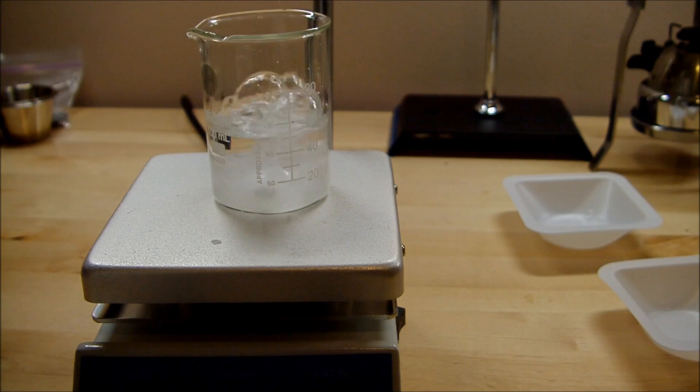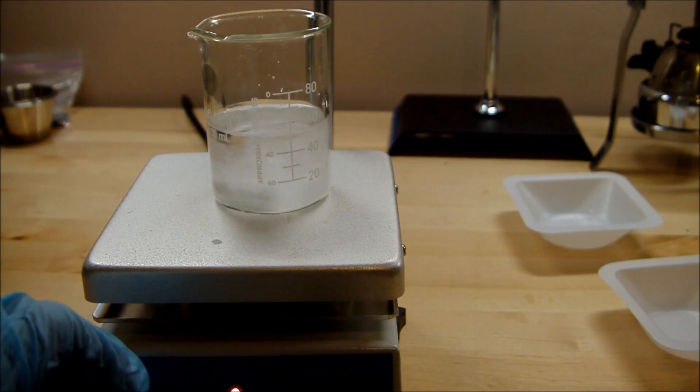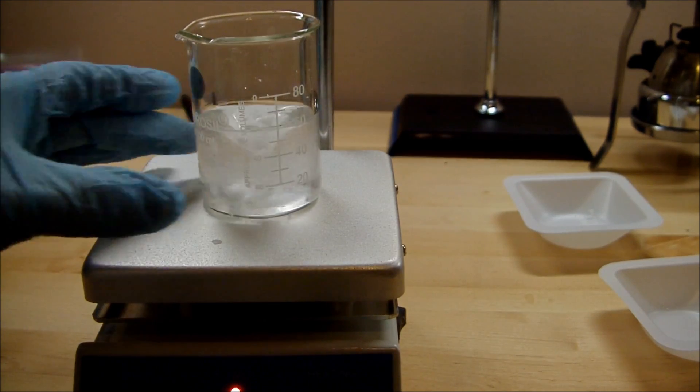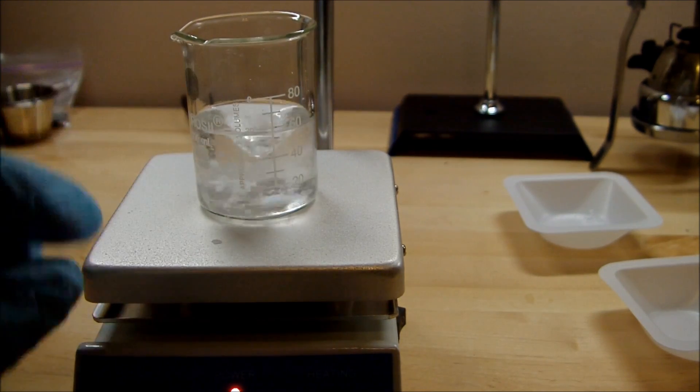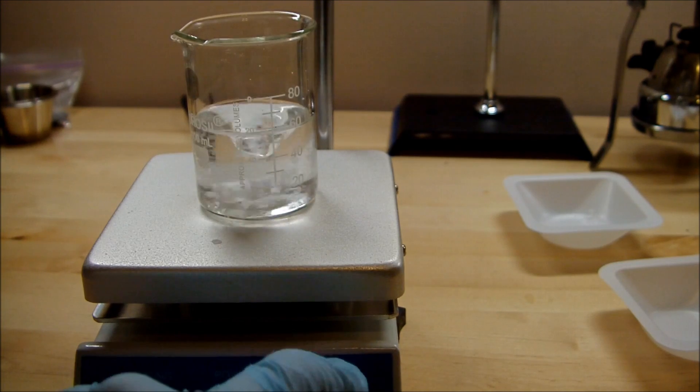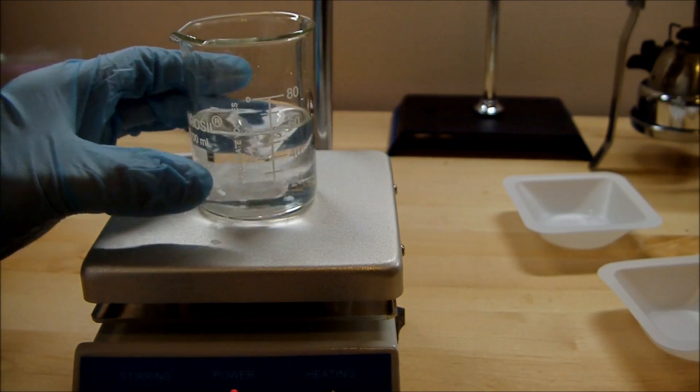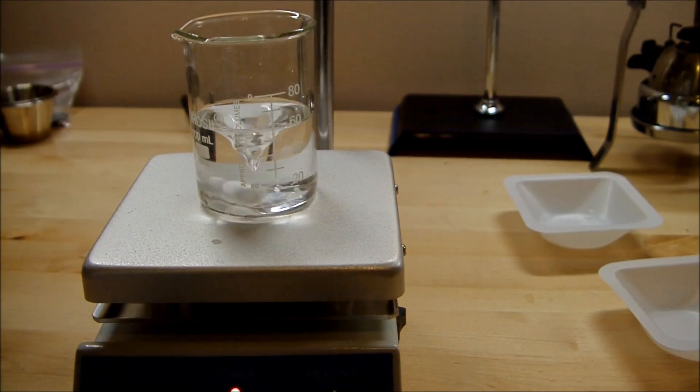We'll toss in a stir bar and let that stir. You may have to heat it slightly as well to dissolve everything, so I'm going to do that. I'll put that on low heat.